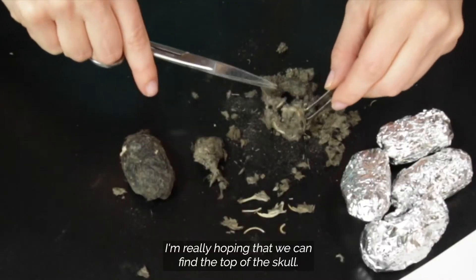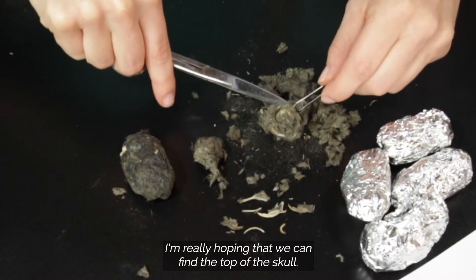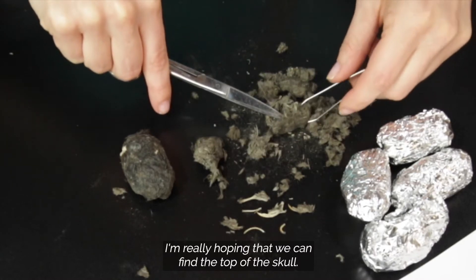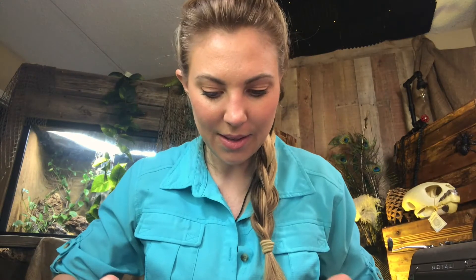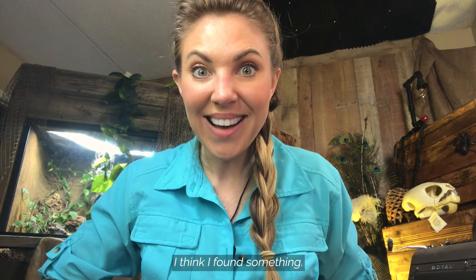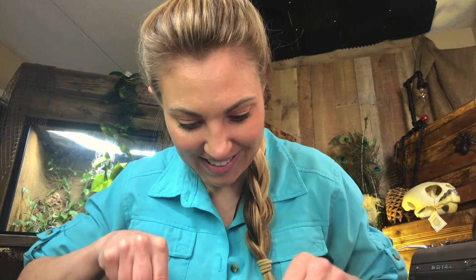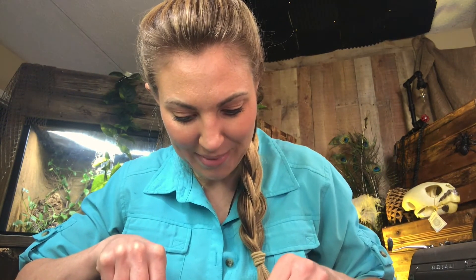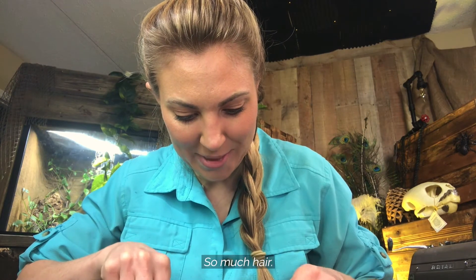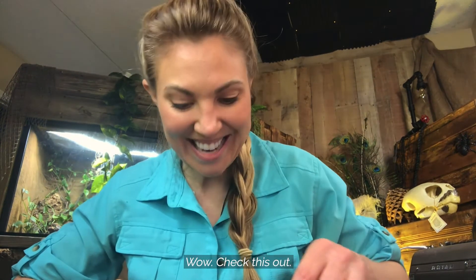I'm really hoping that we can find the top of the skull. I think I found something. So much hair — wow, check this out.